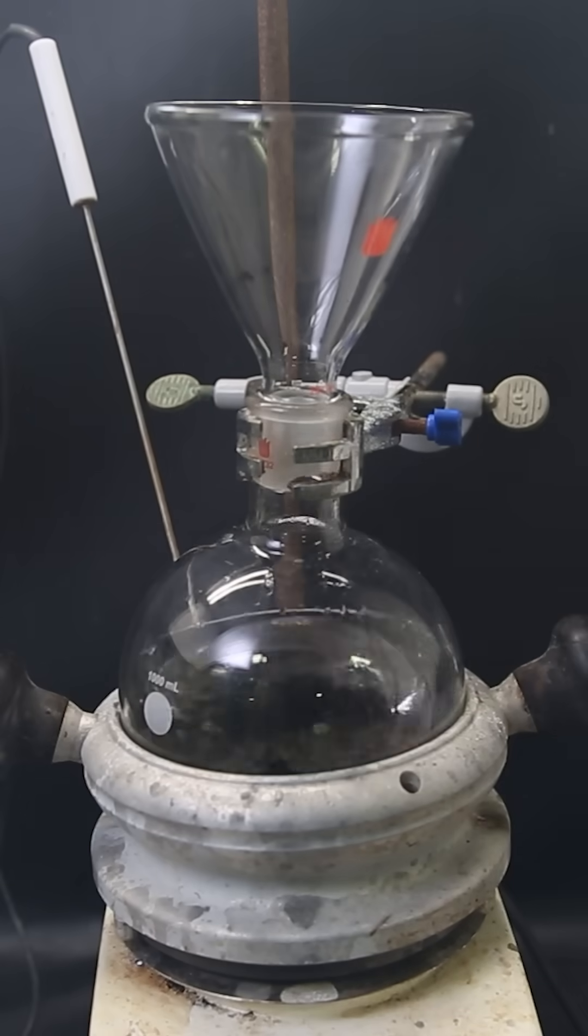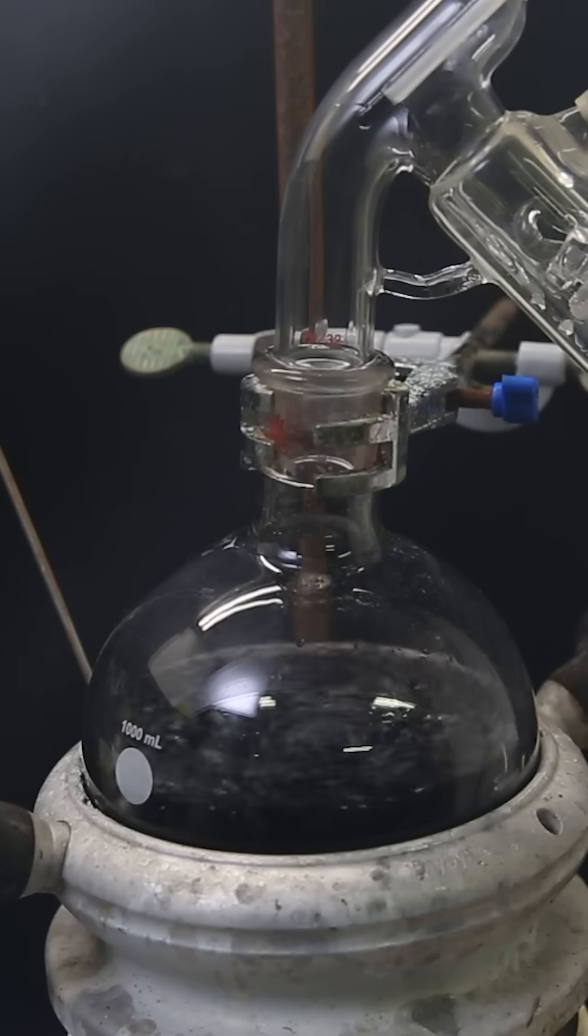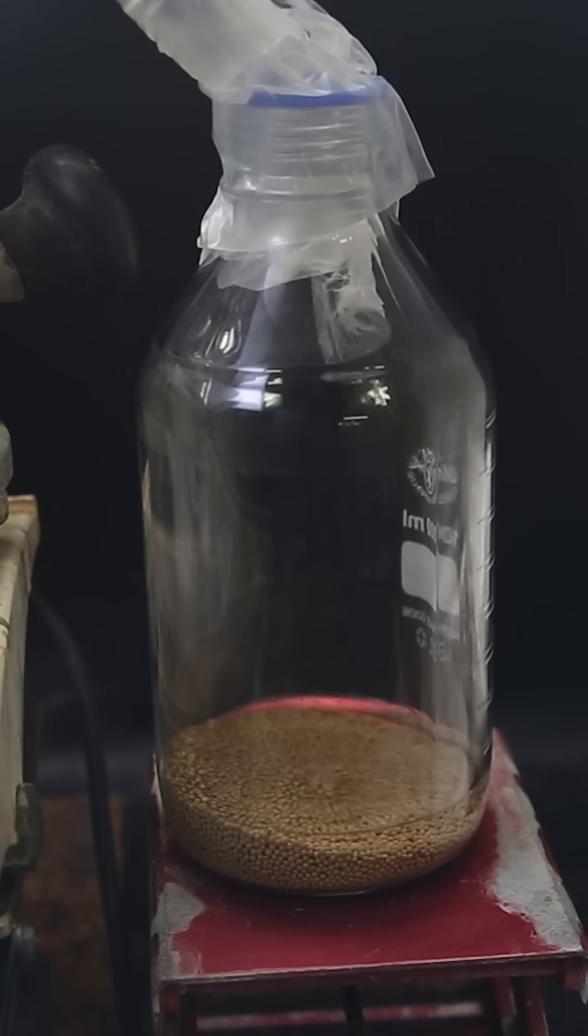I then add in potassium permanganate, which should destroy other remaining impurities. I then distill it all over into a container with molecular sieves, which will continue to absorb any traces of water.